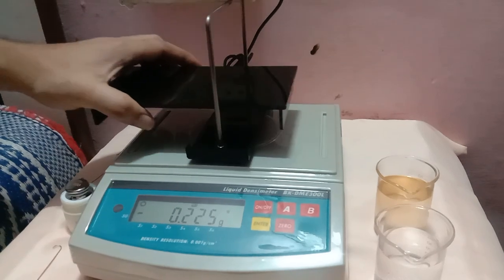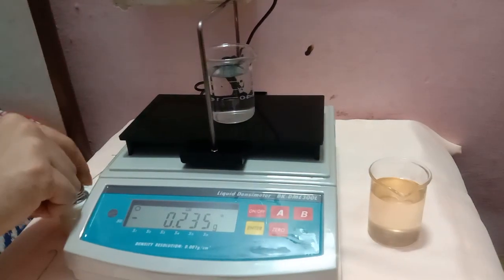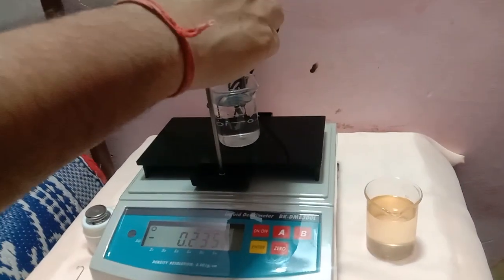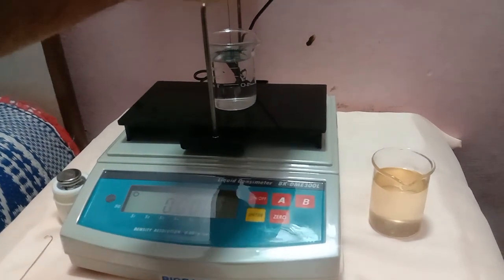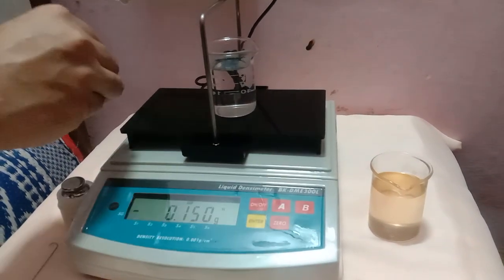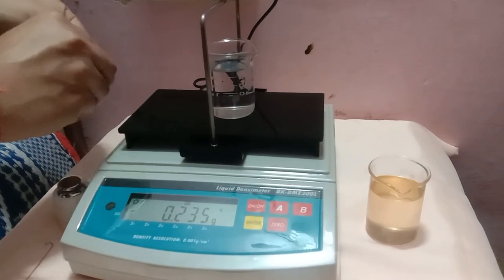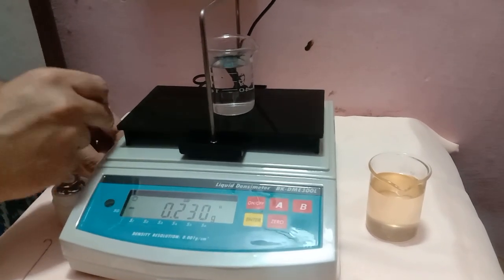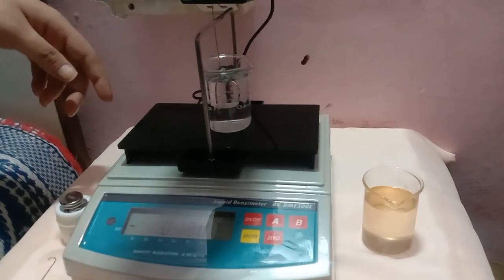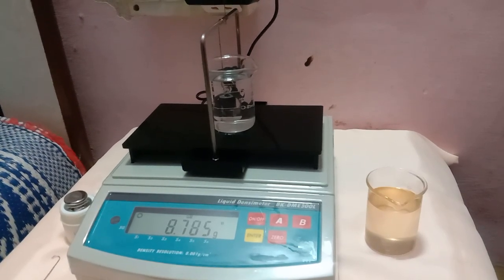Put the base plate, since you will be using distilled water. Put the distilled water in the center. Put the J hook and again reset the value to 0. Now take the weight away and attach it to the hook. Put it in the center of the water, ensuring the water does not spill out. Now it shows the weight value in the water.